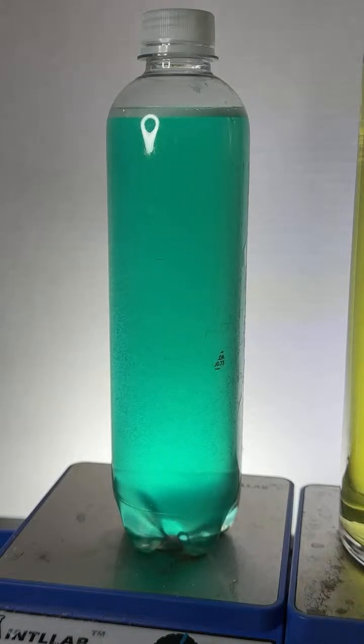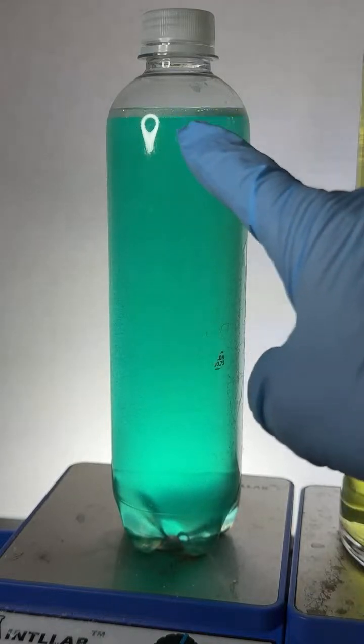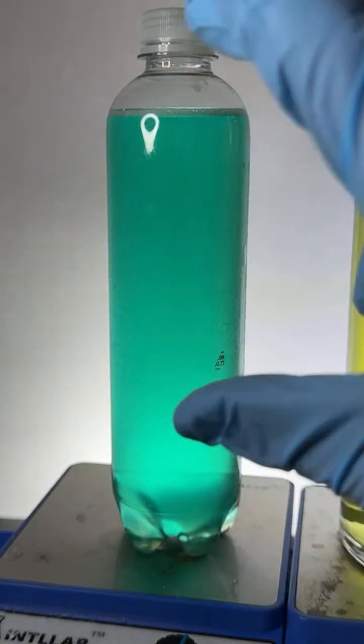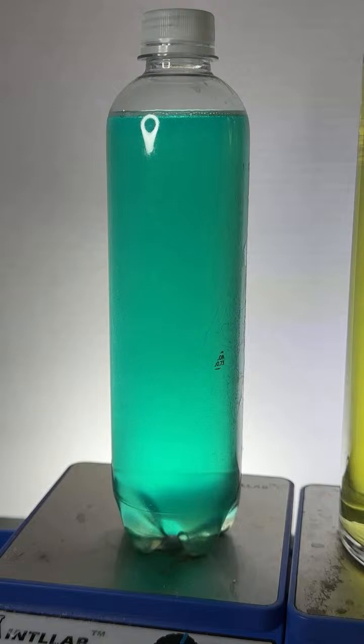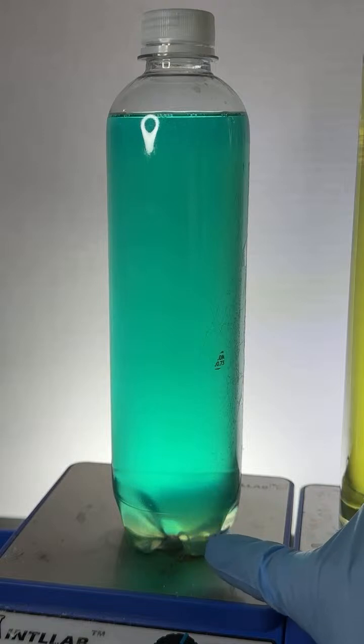It's a mixture of water and alcohol. I added to this a white salt. The white salt mixes very well with the water, extremely well. Uh-oh, do I quit? I might have to add a little more. No, I think it's going to work. And because the salt and the water mix together so well, it pushes the alcohol out.